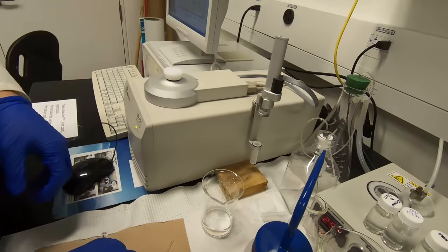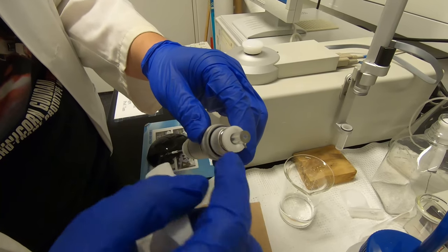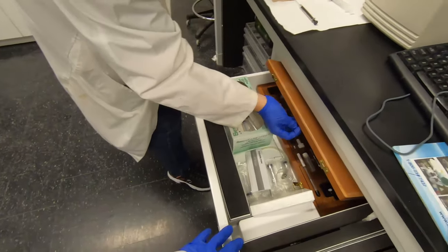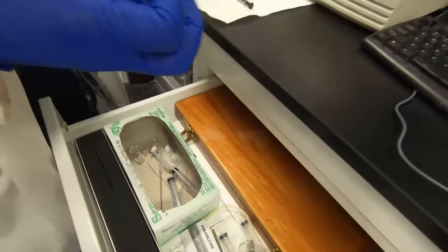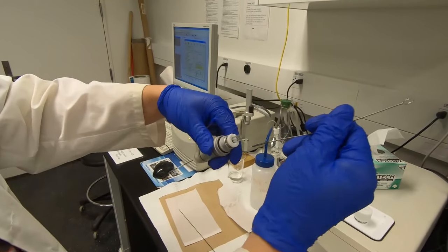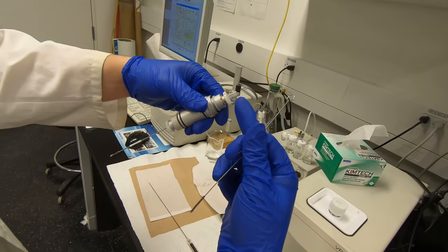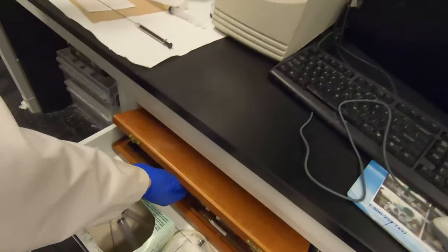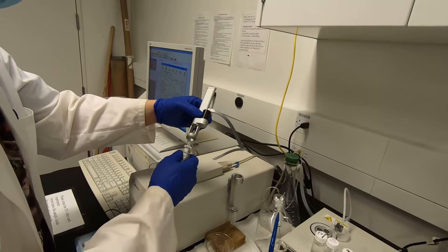For the lower glass or plastic tube, if there's contamination inside, put some cleaning solution in there and use a small brush — like a beaker brush — to scrub inside and clean up all the contaminations. When you reassemble it, just put it back the same way you separated it, then screw the metal ring back on. After washing, leave it in the open position.